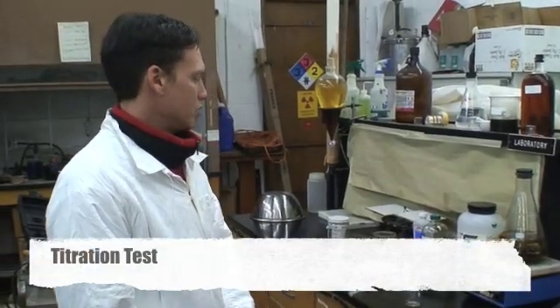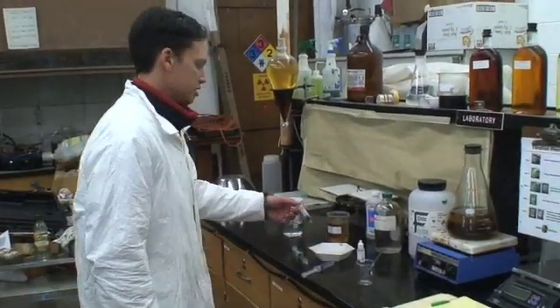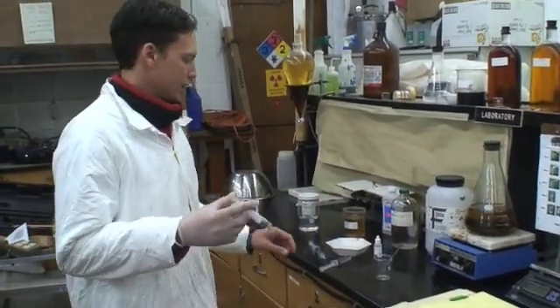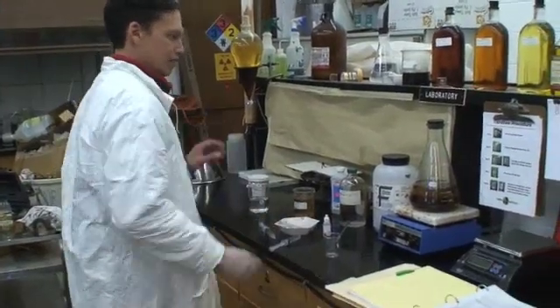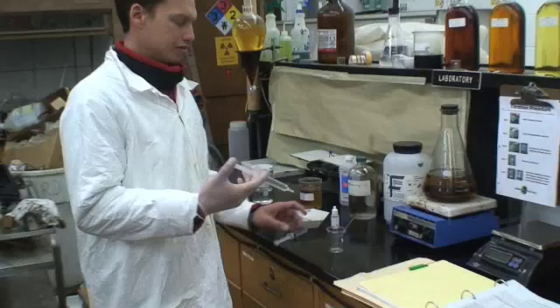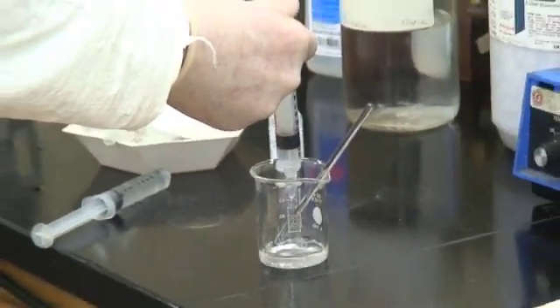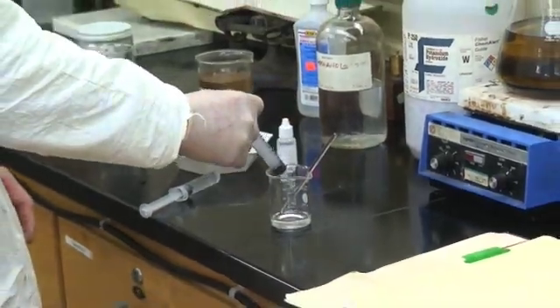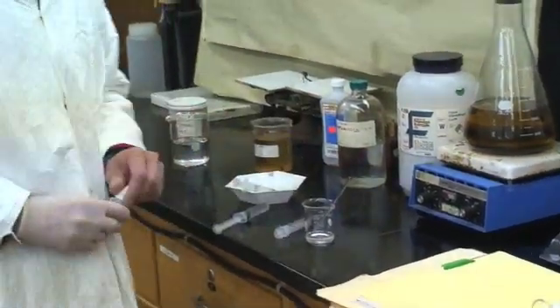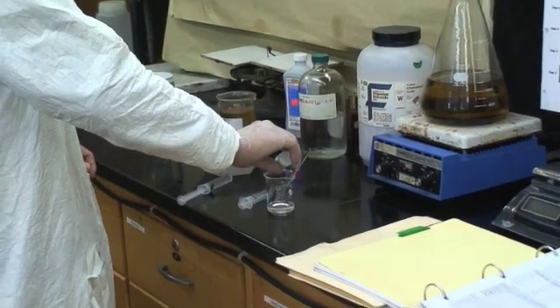AC Biodiesel — we're going to go through the steps of titration for some sesame oil that we got. First of all, we're going to put 10 milliliters of alcohol into a beaker. Then we're going to put two drops of phenolphthalein.